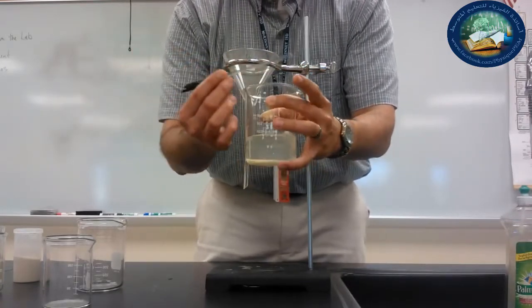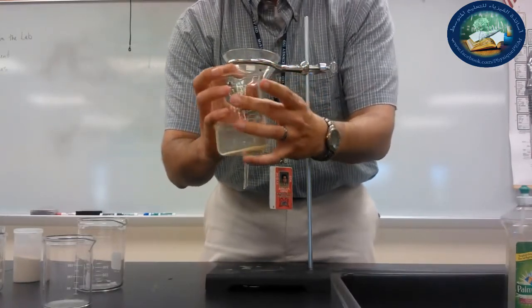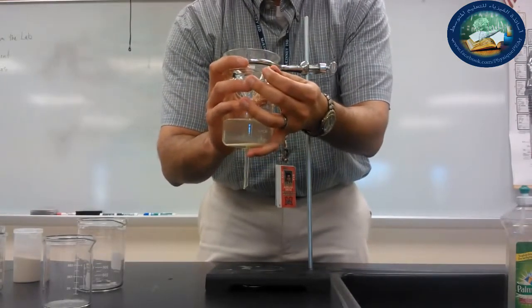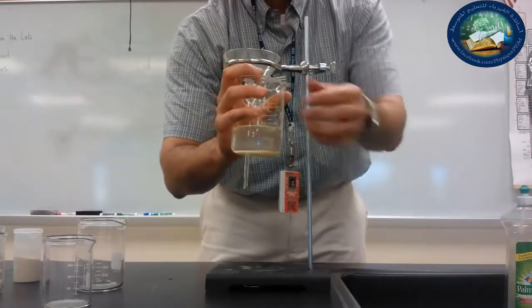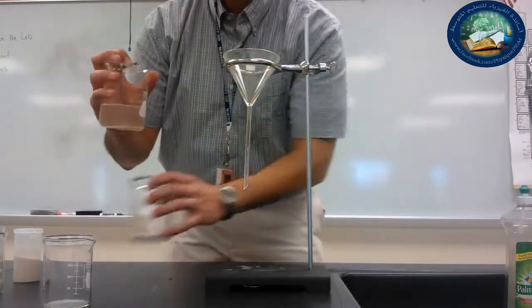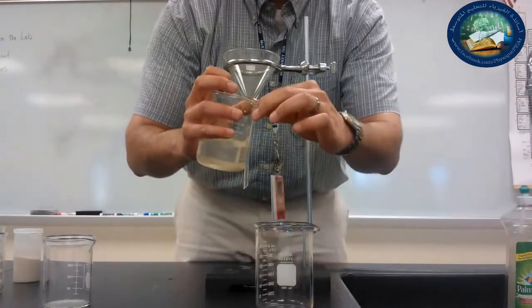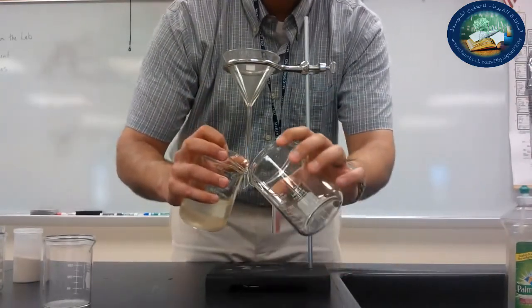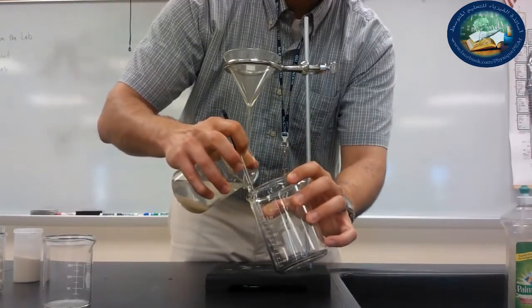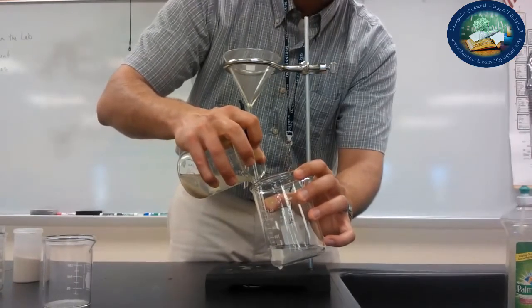Now notice I'm going to take my chemical spatula and put it over the top so that the glass part of this spatula is on the spout of the beaker. I'm going to hold it with my hand like this, and I'm going to use it to pour into another beaker. What I'm trying to do is minimize splashing so that I don't lose so much of my solution. So I'm going to place this against the wall of the beaker, and pour it carefully, just with a slight tilt, so that it pours into the beaker. And notice there's no splashing, right?